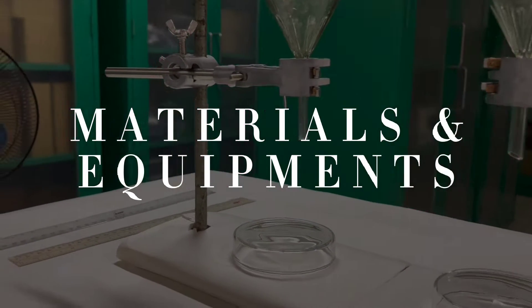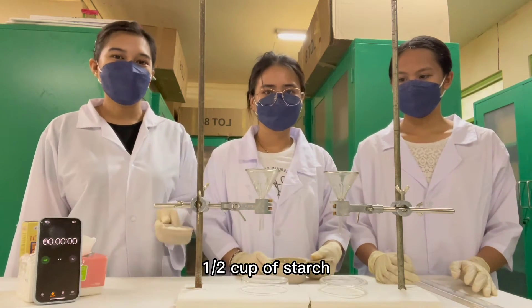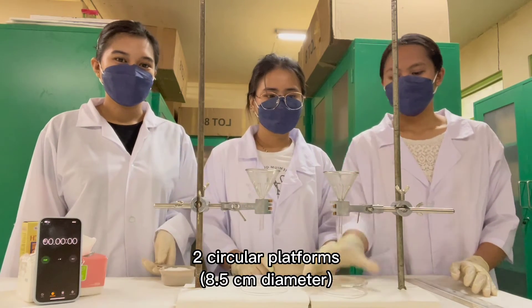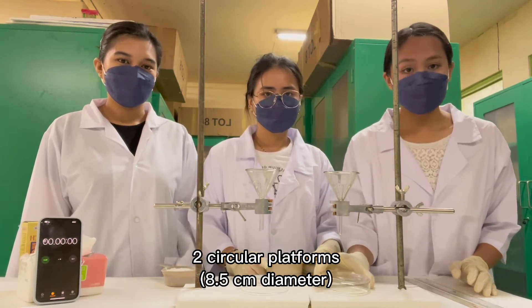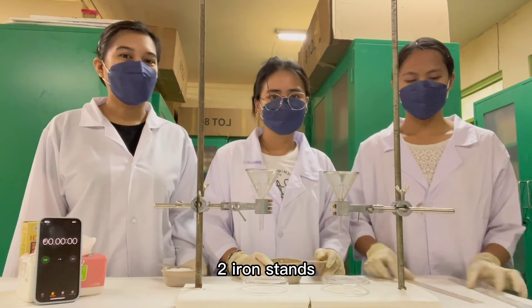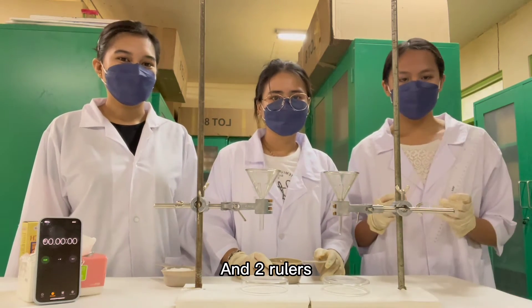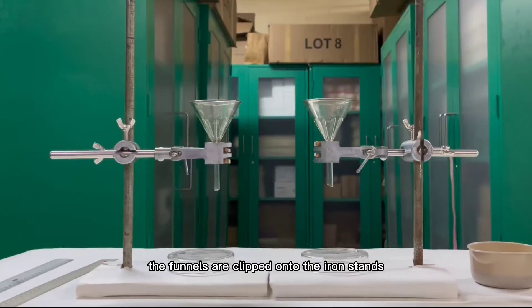In this experiment we will need one half cup of granules, one half cup of starch, two circular platforms with a diameter of 8.5, two funnels, two iron stands, and two rulers.